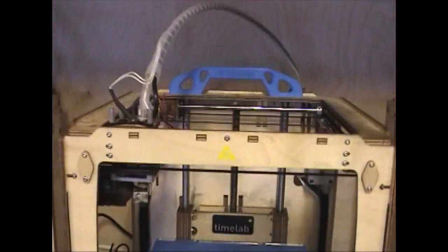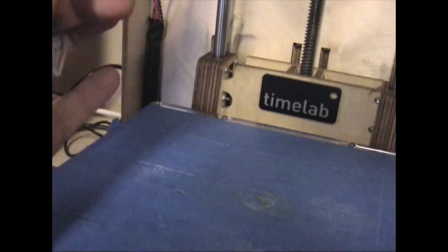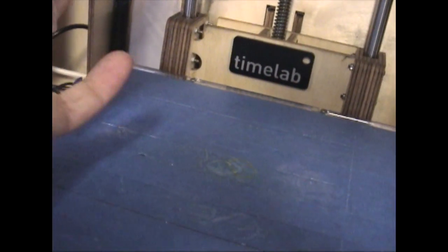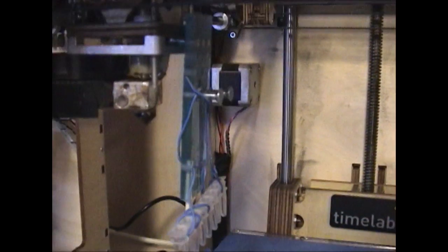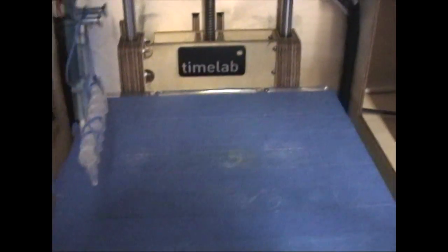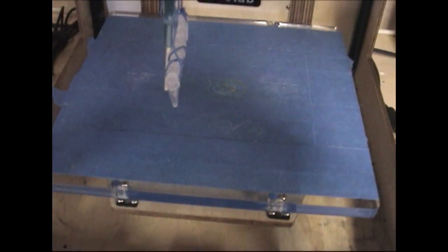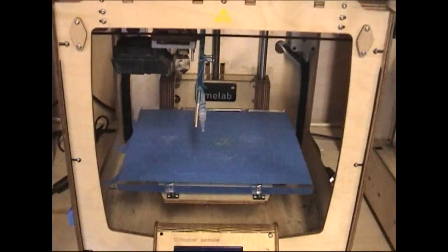So here we have a 3D printer, and on top we have the sample holder, and that's it. It can be connected easily, secured by tape, and then it can move between different positions. Position 1, position 2, position 3, and the bottom is moving up and down according to the program. Then that's it. Very simple, but I would prefer to do it by hand.